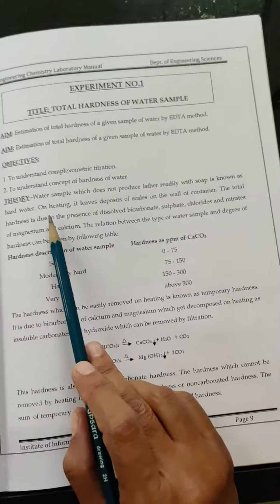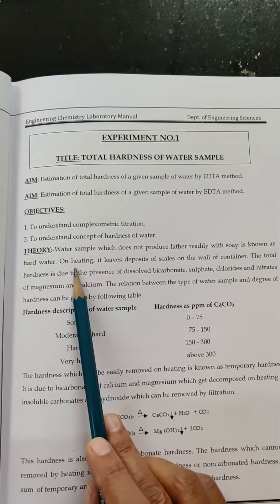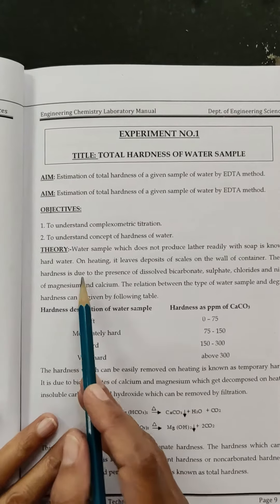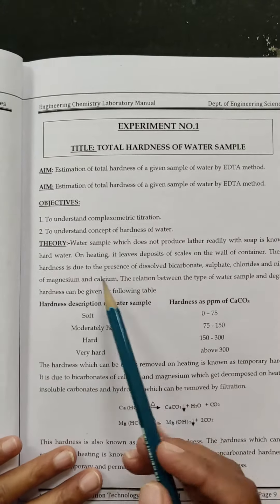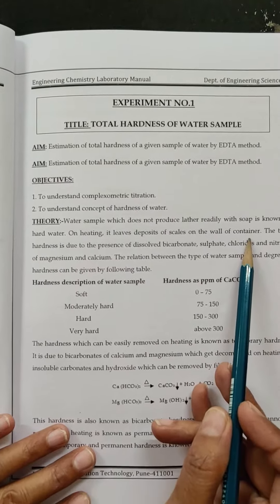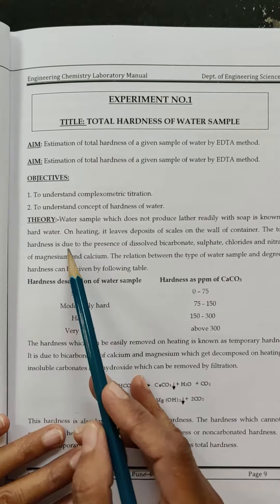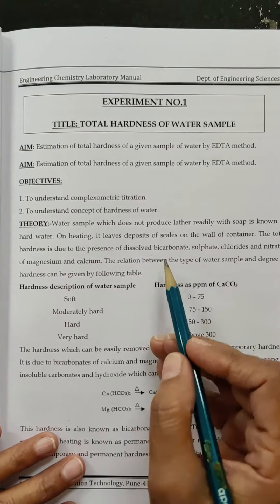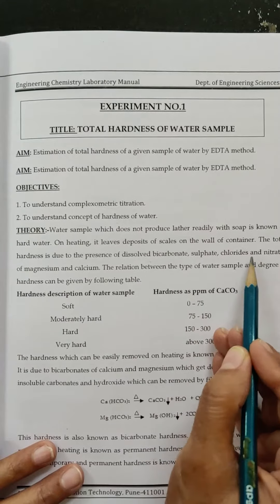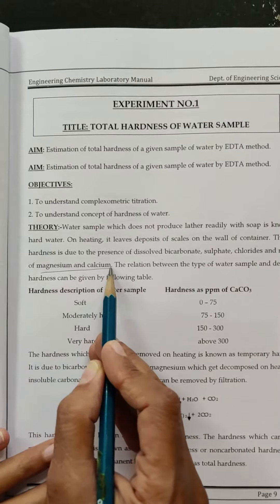The water sample which does not produce lather readily is called hard water. On heating, it leaves scale on the container, which is called hardness. The total hardness is due to the presence of bicarbonate, sulphate, chloride, and nitrates of calcium and magnesium.